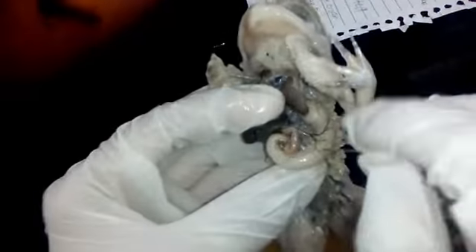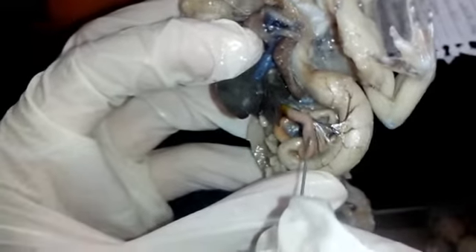This is the stomach. Inside the stomach, there are fold structures called the rugae. This is the mesogaster, a web-like structure that connects the stomach to other organs like the pancreas. The pancreas secretes digestive enzymes.